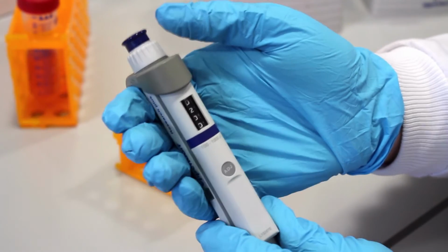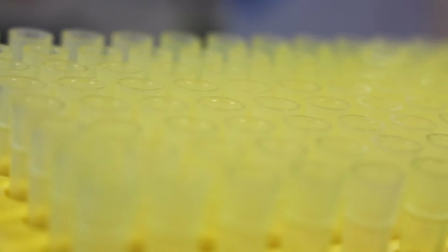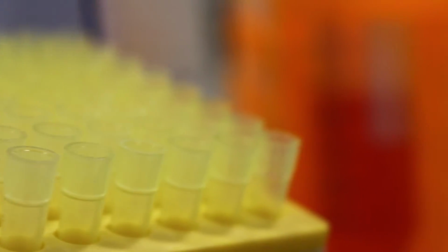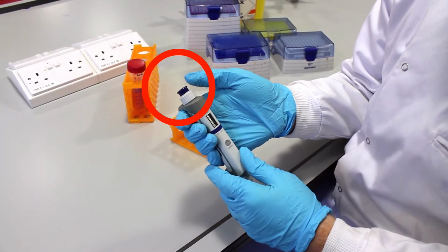However, its use is going to be very important, and how you use the pipette. And I know this sounds simple, but it's often a place of error when many people are learning or early in their scientific careers. Now, we will be selecting our pipette tip based on the color code later on, but I really want to show you how this device works at the top.